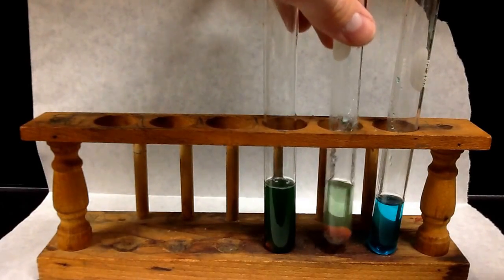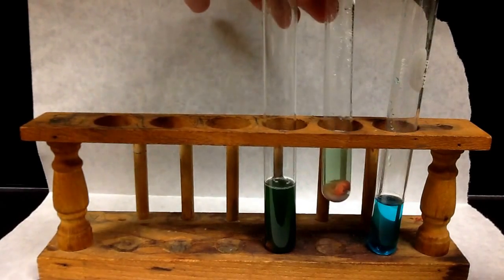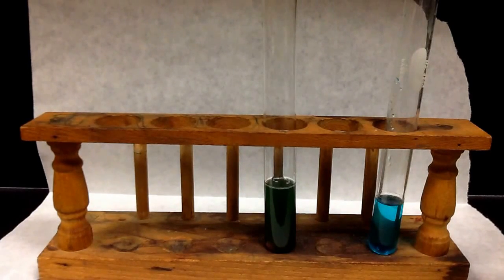And even though it's still reacting, what I can do just to show you an up close picture of what that solid looks like is I'll pour out the liquid, or decant the liquid, I should say.